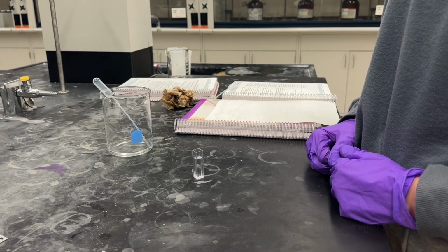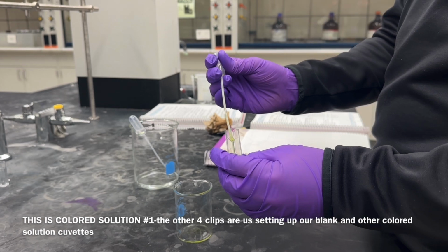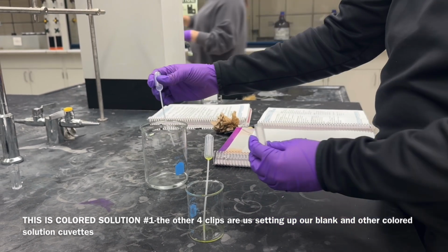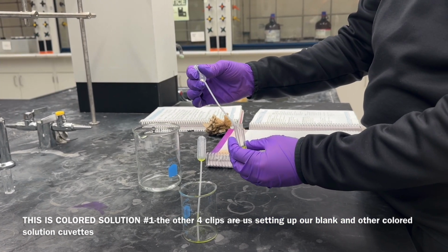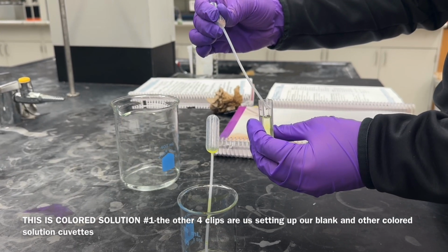Okay, so as always, first things first is safety. As you can see, we have our proper lab attire, gloves, goggles, all of that. So in the second exercise of your chromatography lab, you're going to start getting the samples that you'd like to scan in the spectrophotometer into little cuvettes. There should be a total of 4 samples.